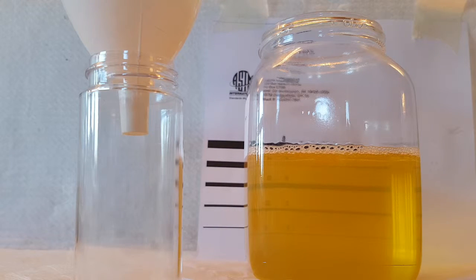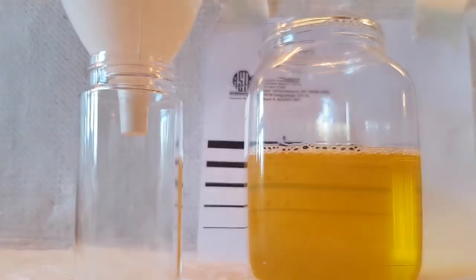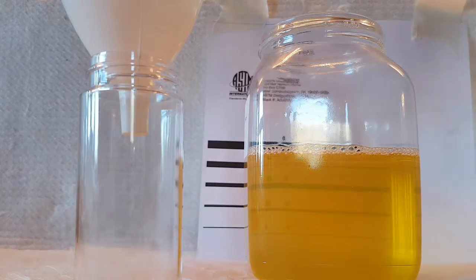So I'm going to put some of that into the 100mm for you, and then I'll put some more water in. At the moment it's got about 2,300 parts per million of water in.